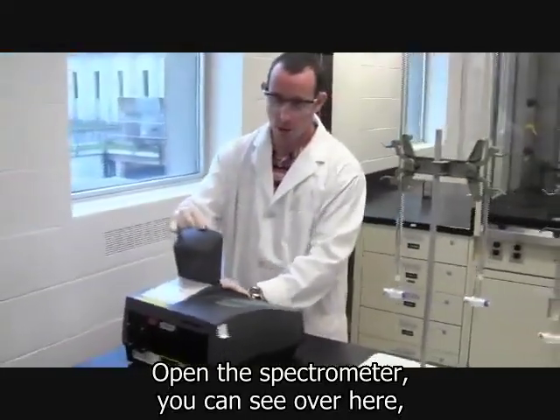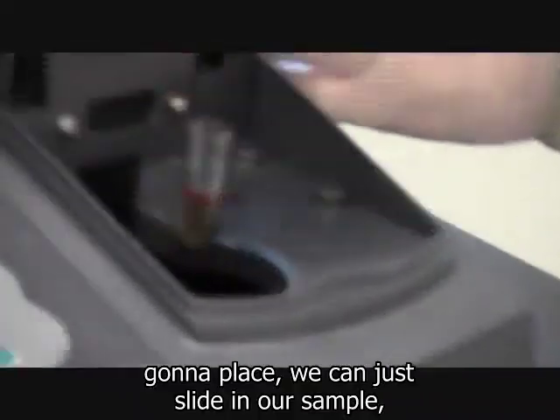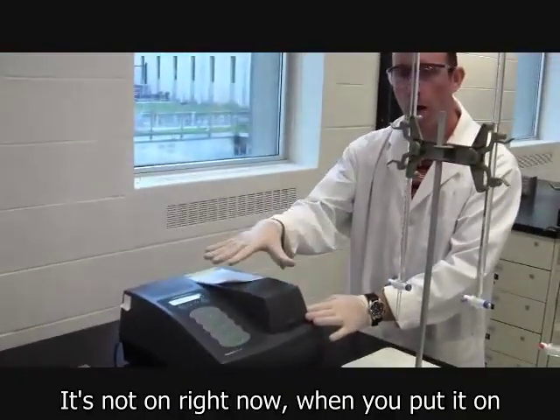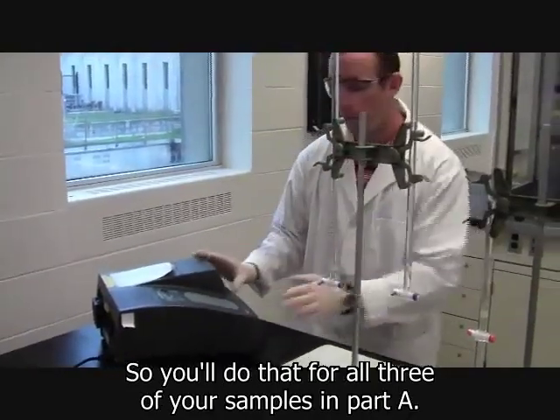Open the spectrometer. You can see over here, we've got a place where we can just slide in our sample. Turn it down, and we're going to get a reading of what the absorbance is. It's not on right now, but when you put it on, you'll get an automatic reading. So you'll do that for all 3 of your samples in part A.